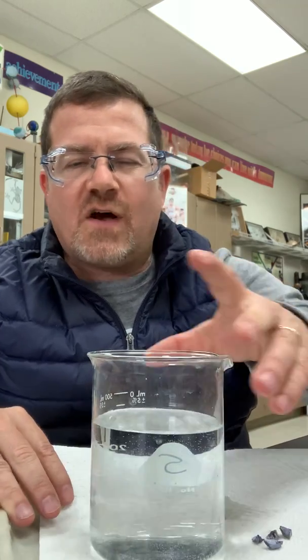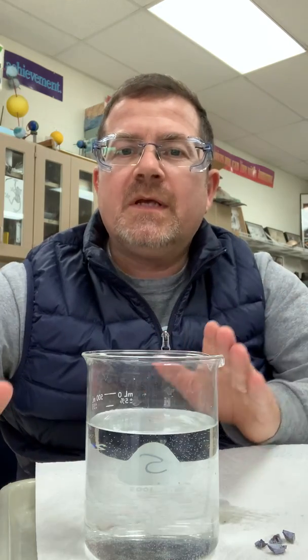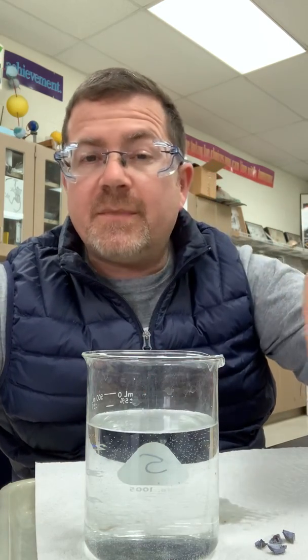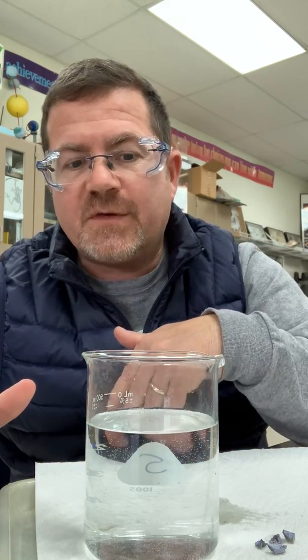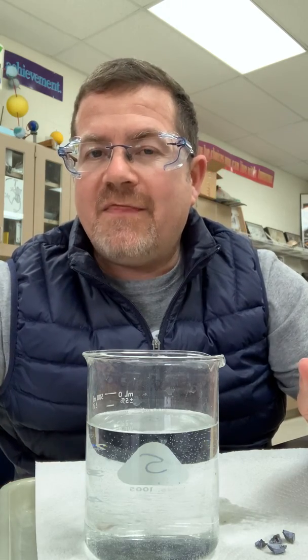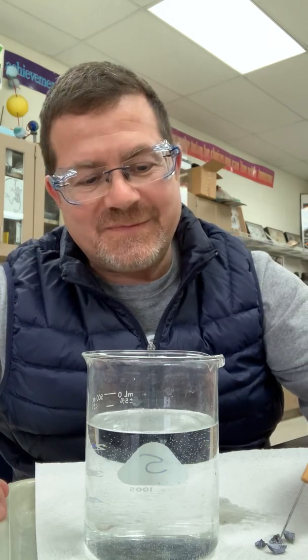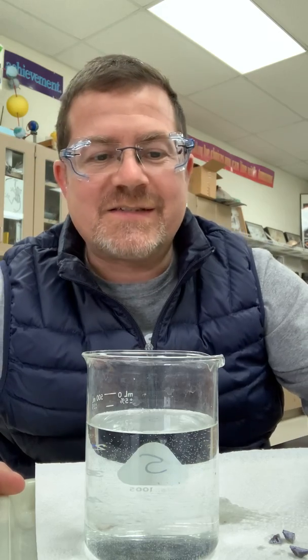One of the things you saw with lithium was that it buzzed around the top, but it didn't catch on fire. The next one you saw, sodium, buzzed around for a little bit, but then it eventually caught on fire. So on this one, you might want to go back and look at the videos and figure out if this one catches on fire faster than the lithium and the sodium. That's something you might want to check.